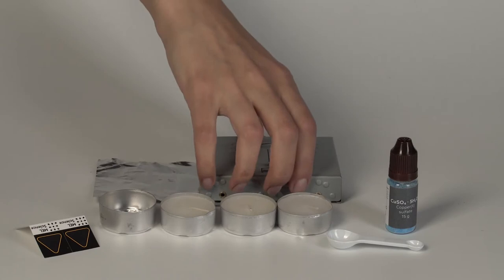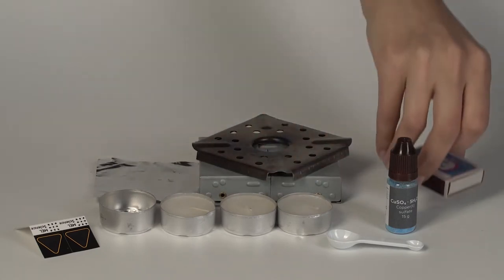You will also need the solid fuel stove and the flame diffuser from the starter kit. Prepare matches.